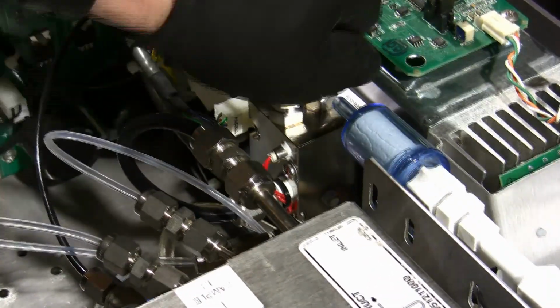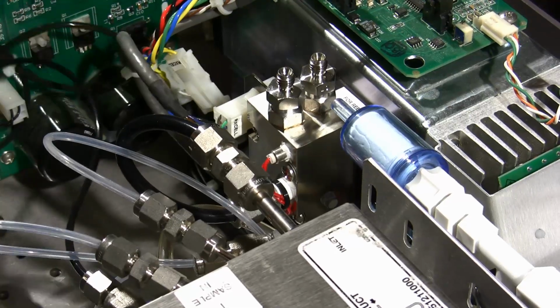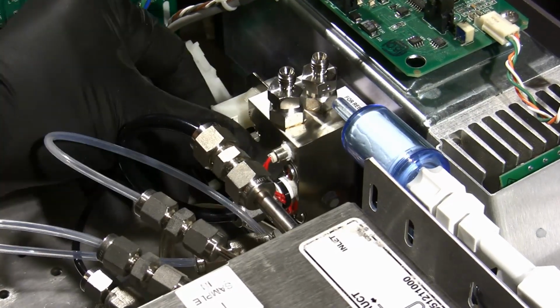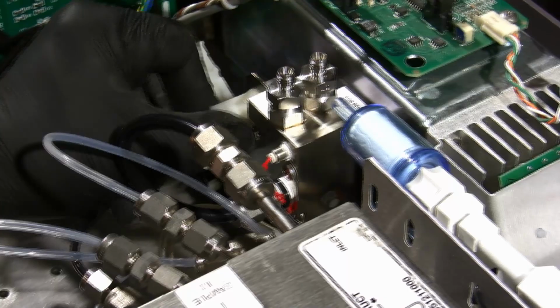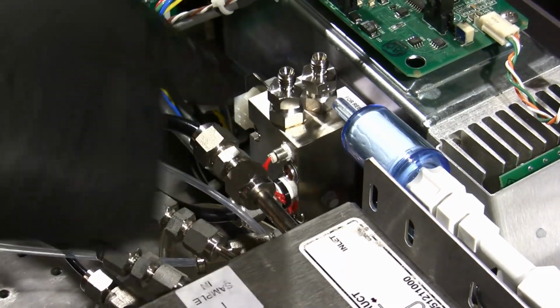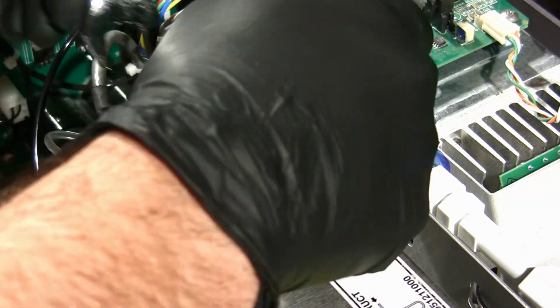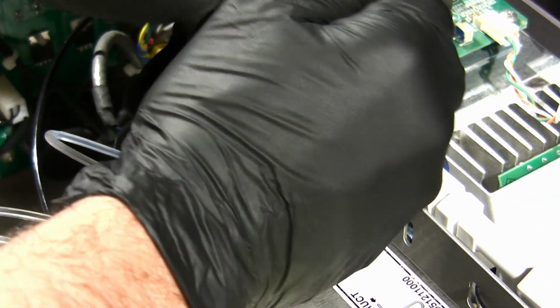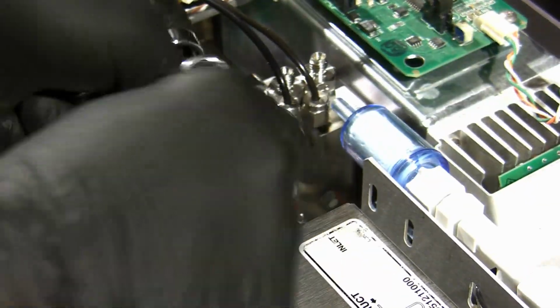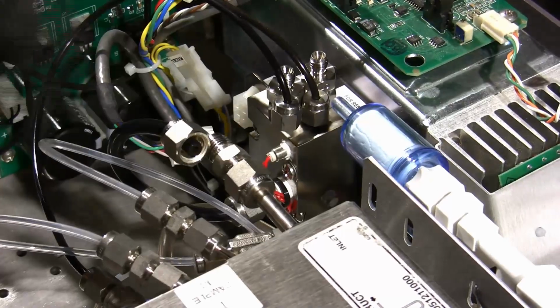We're going to take off both of these 1/8" tubes and get those out of the way. This electrical connector here, we can just squeeze and pull off. Go ahead and get this 1/4" tube out of the way to make things easier to work. That's our exhaust out of the reaction chamber and into our ozone destructor. It's a heated destructor there.